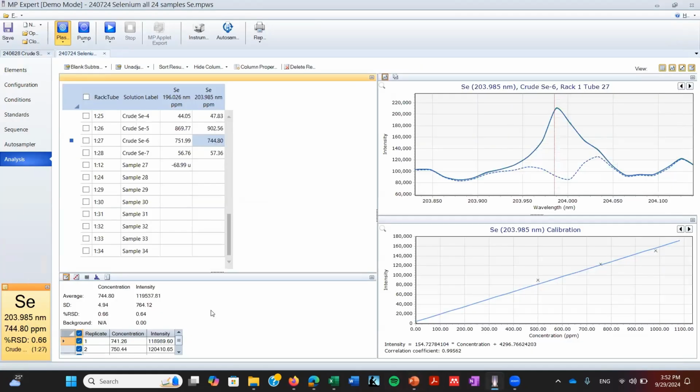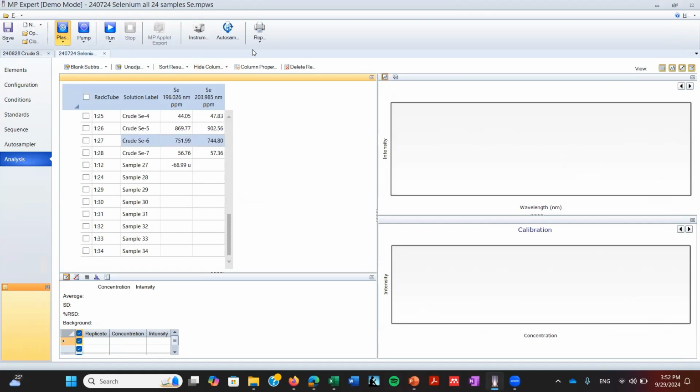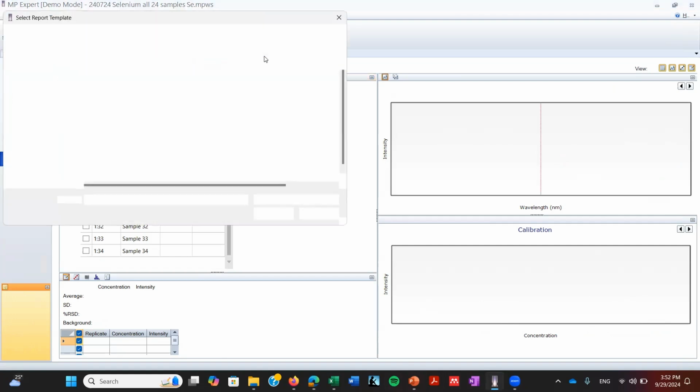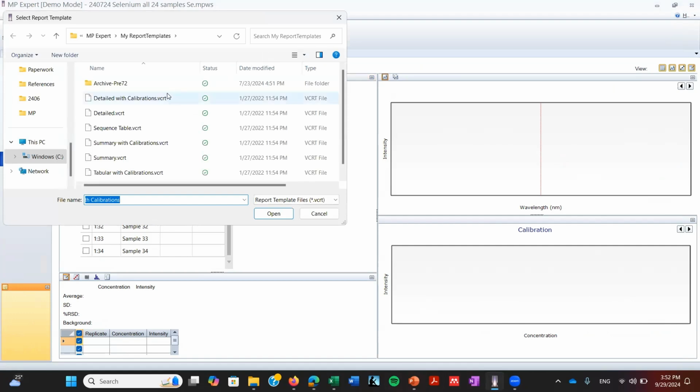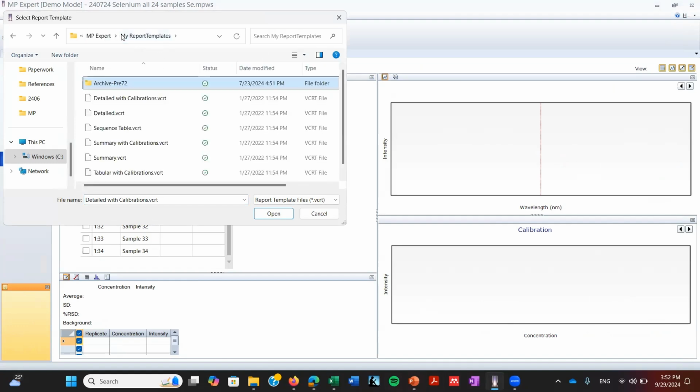Now we're going to talk about export options, although we already kind of talked about that because we saw how we can copy with headers. So there's another way to do it. We can generate a report. When we generate a report, we need to select a type of report template. You can select this one, for example. We put open.